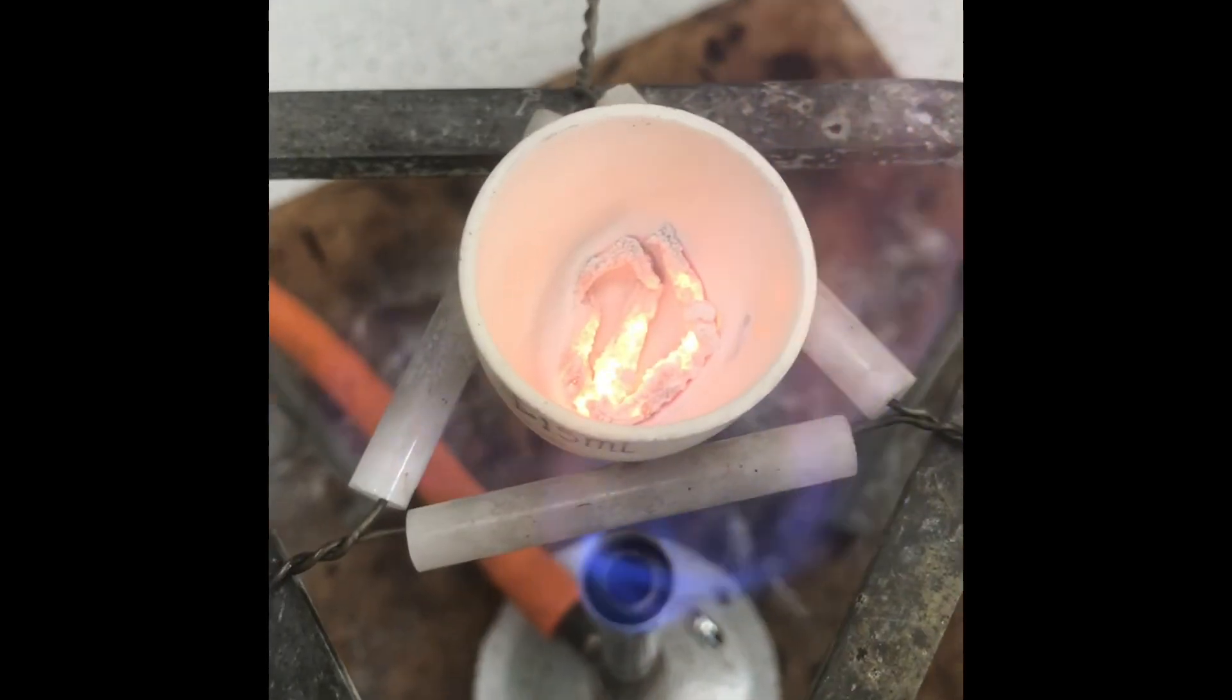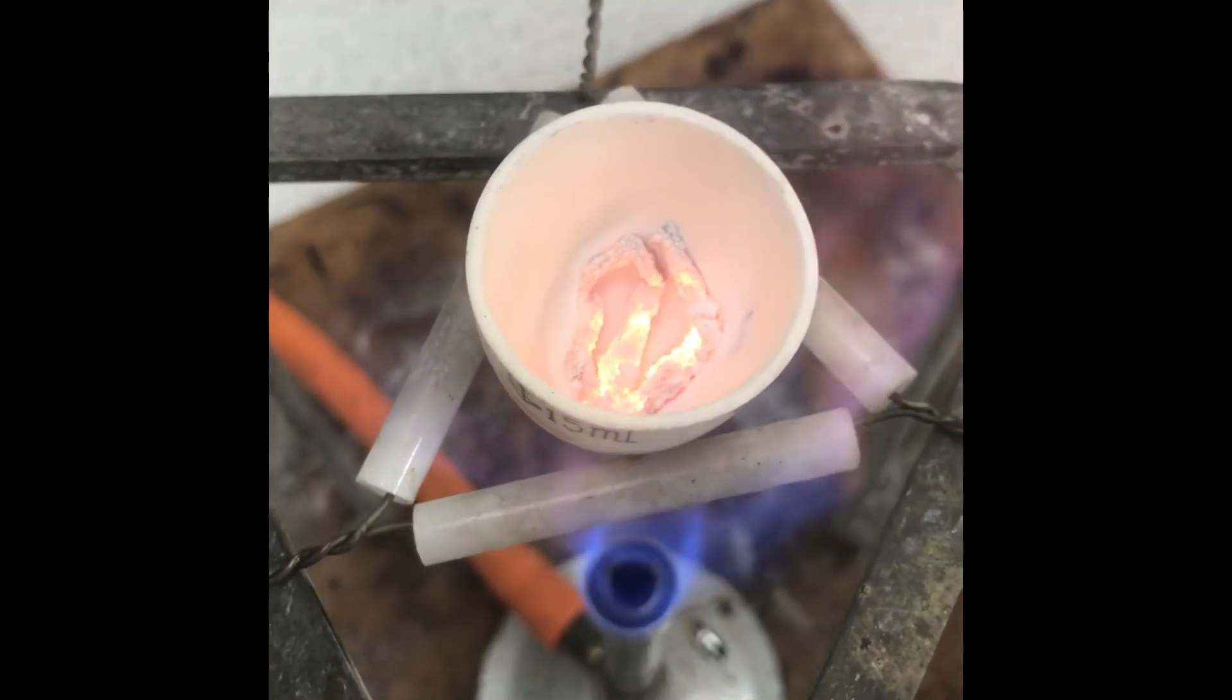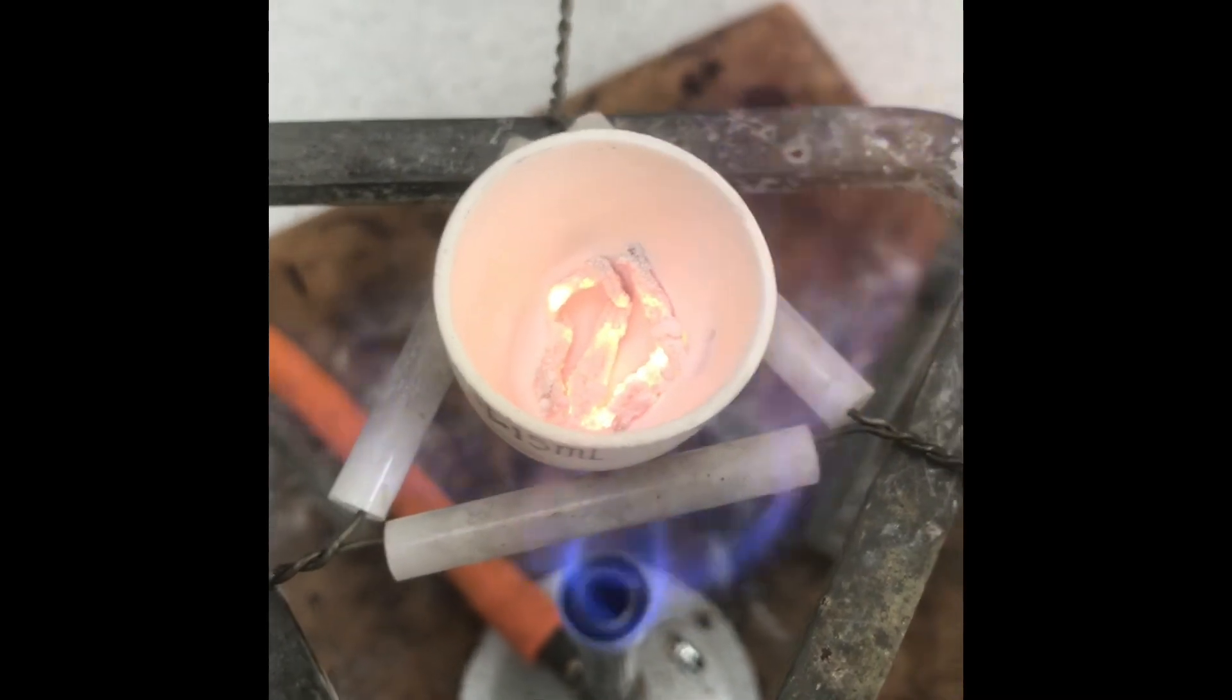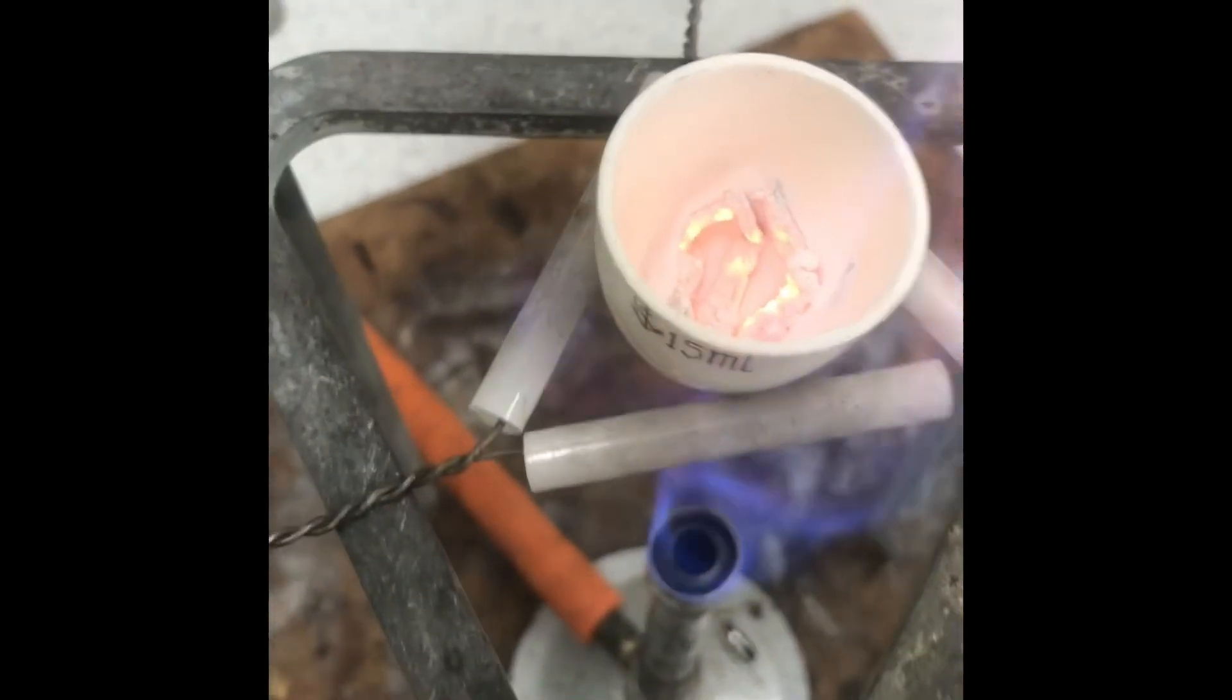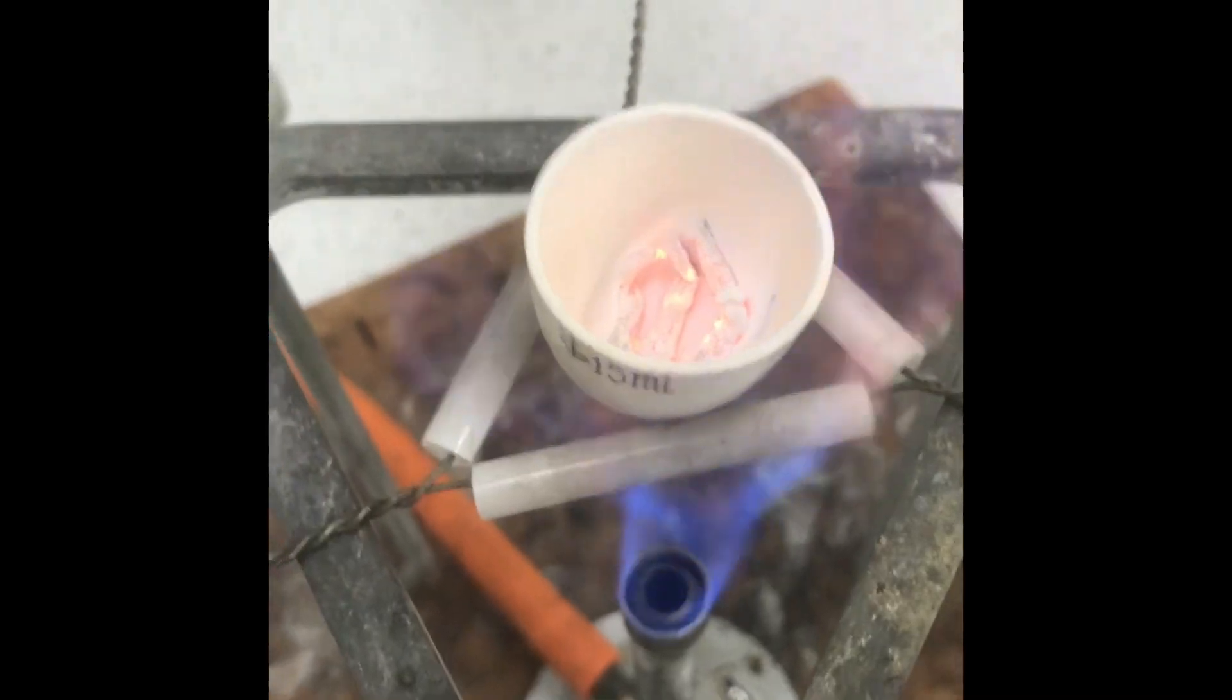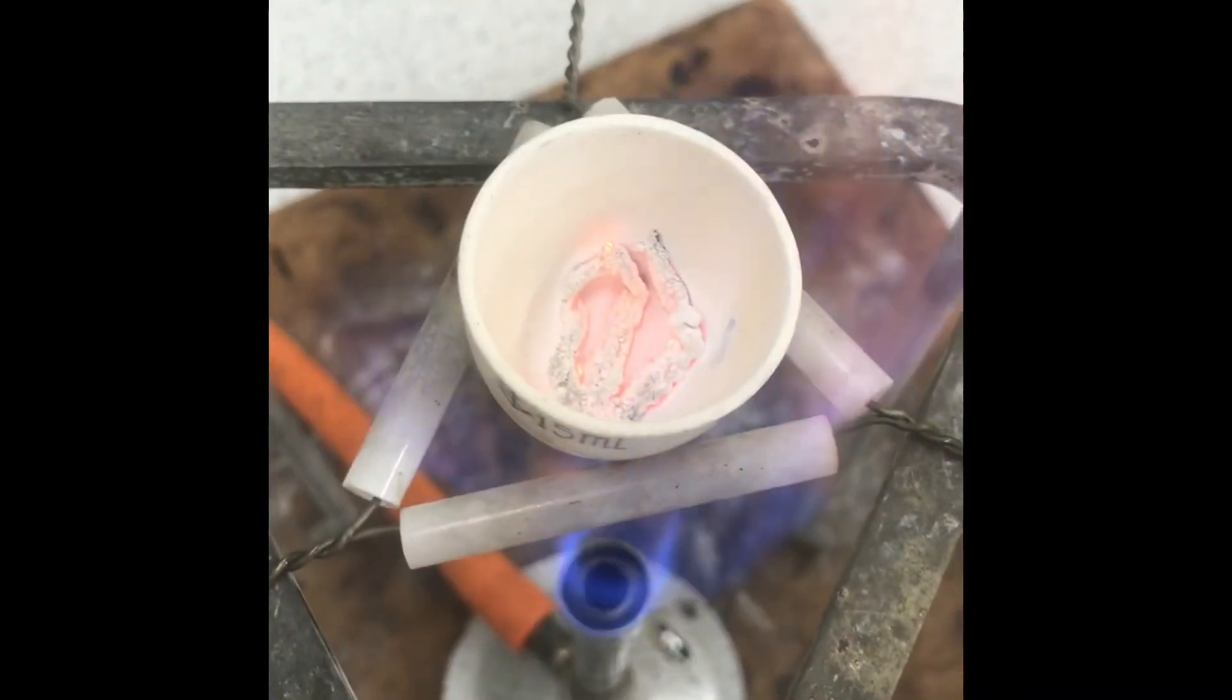It has now been about 30 minutes, and we can see the magnesium looks quite different. That's because magnesium oxide has begun to form, so magnesium is chemically combined with the oxygen from the air.